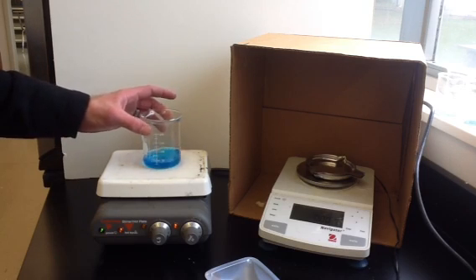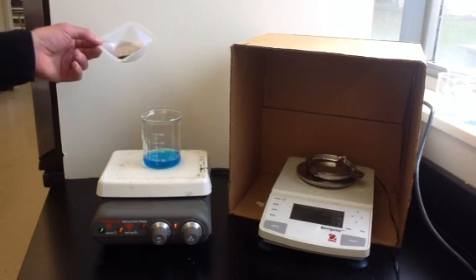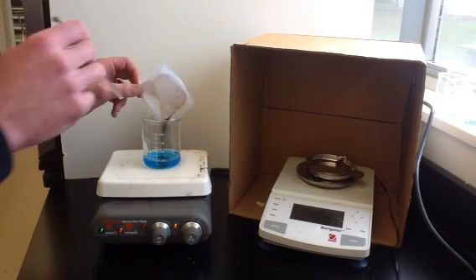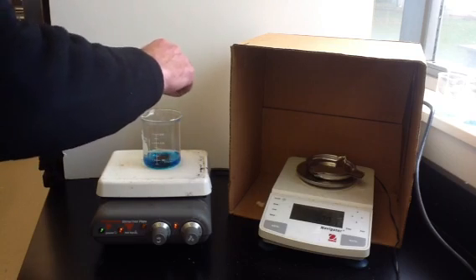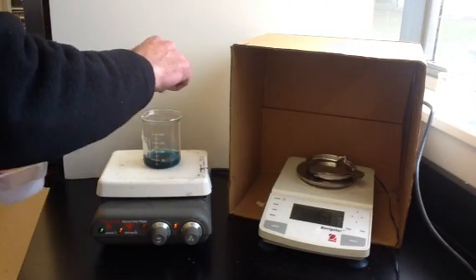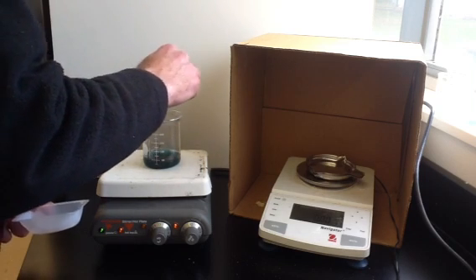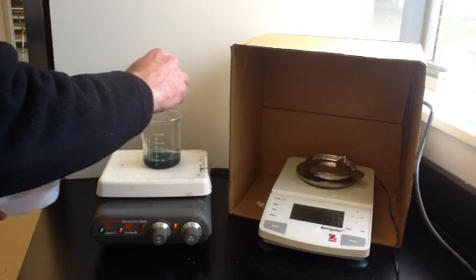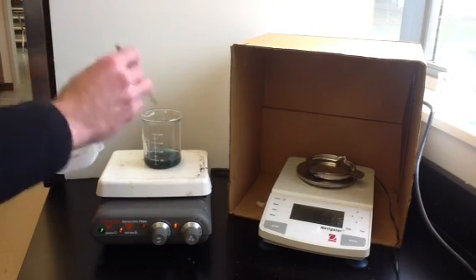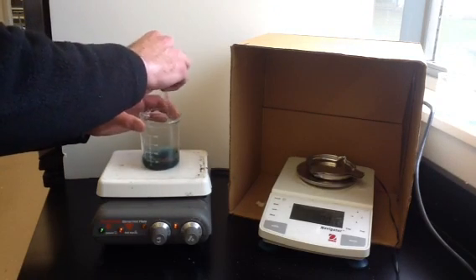This doesn't need to boil — we just need to get it warmed up to help the reaction happen a little bit more easily. We're now going to take our iron filings and pour them into our copper 2 sulfate. We'll pour that in and stir. You can see pretty much right away something's happened. The iron filings, which were a blackish color, have started to become more of an orangish copper color.